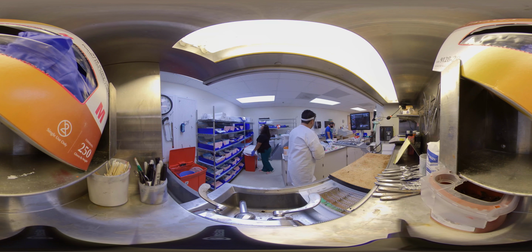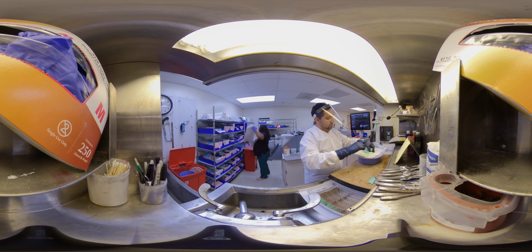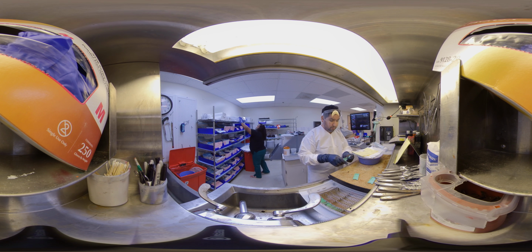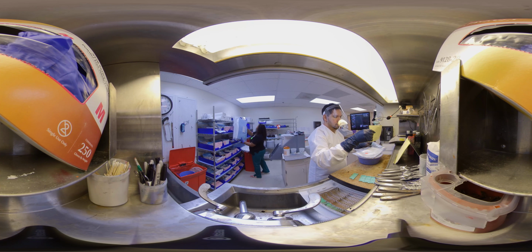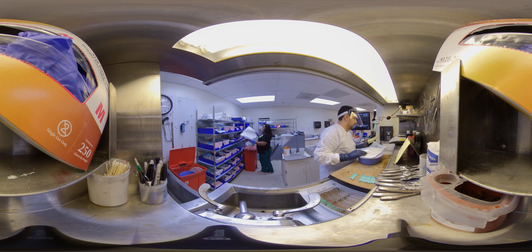What you see here is the grossing tech grabbing a specimen which he's about to do the grossing process on. He is now laying out the green cassettes, which contain the unique number that was generated in the accession area when the specimen was initially received in the histology department. He is now documenting and verifying what has been received by the use of a voice recorder. Once the verification process has been completed, the grossing tech will start dissecting the specimen.